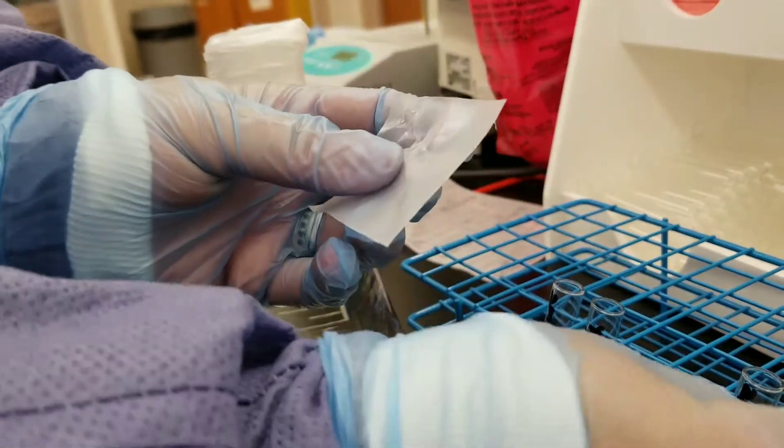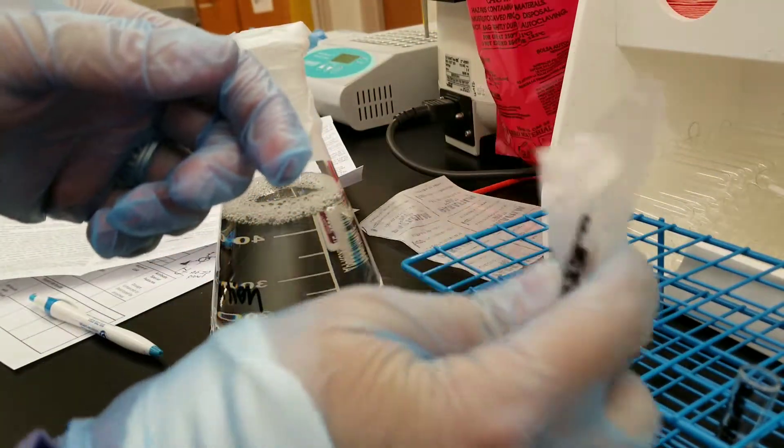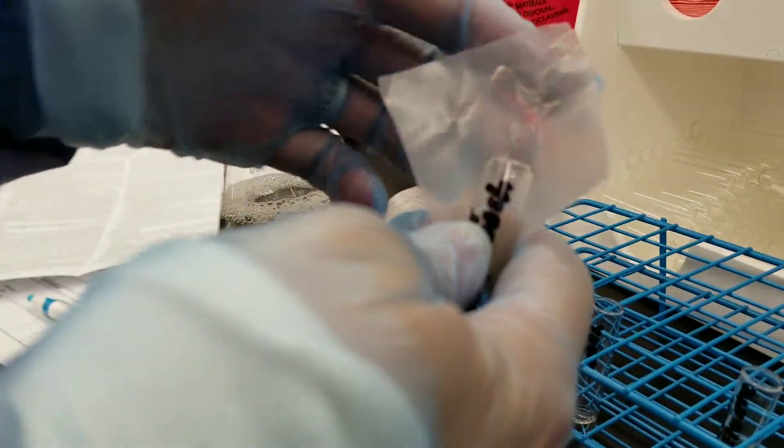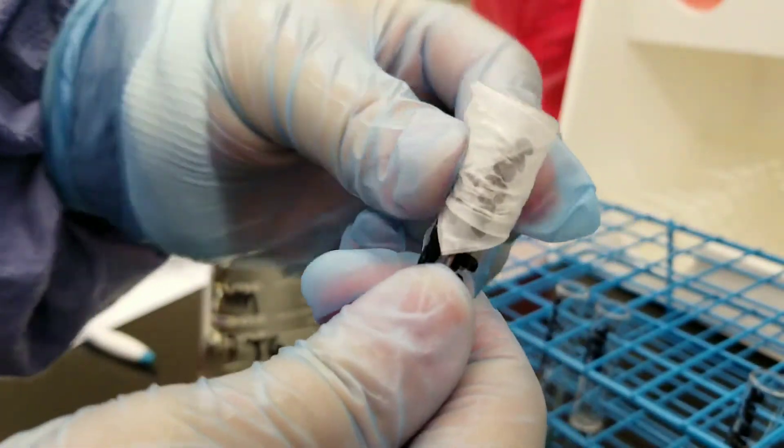So the same thing with the tube. I hold it with a finger and then I pull it over the lip of the tube and then I wrap it around the tube like this.